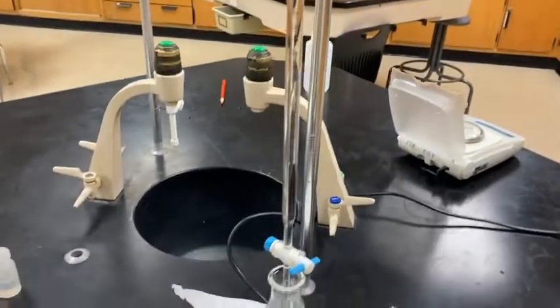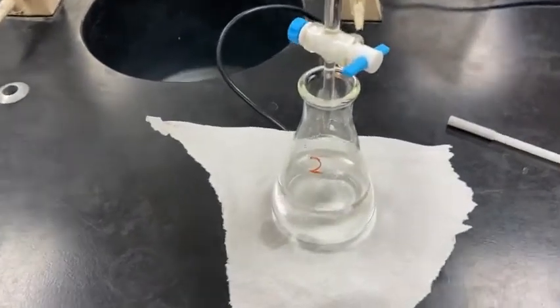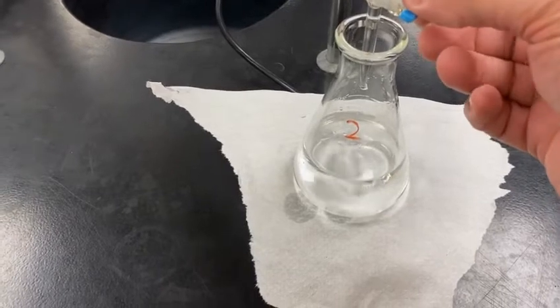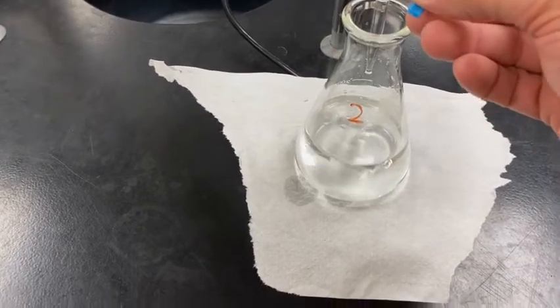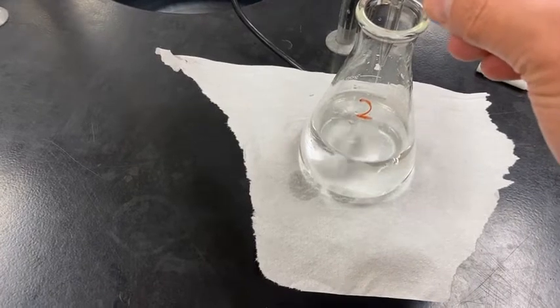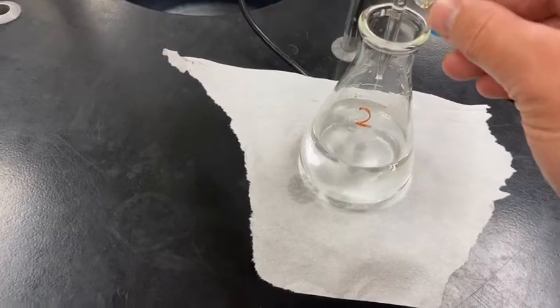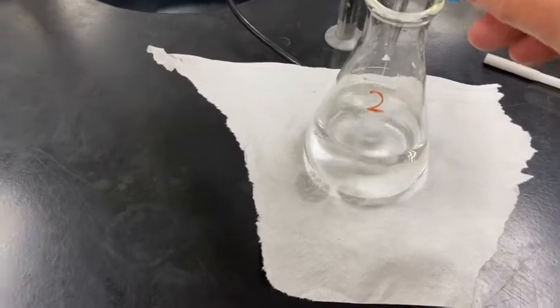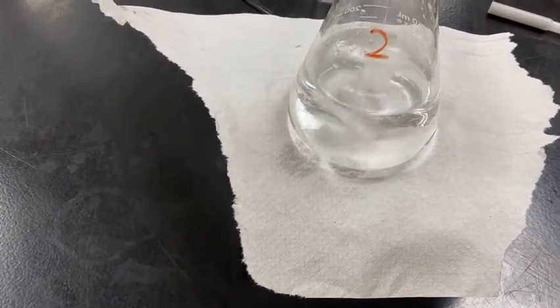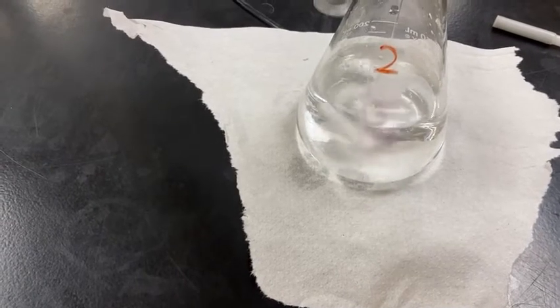Okay, now trial 1, we have an idea of how much volume it took to get it to the end point. And so I know I can blast through the first 30 or so milliliters here of the burette and be pretty safe. So that's exactly what I'm going to do. I'm going to speed this process up. And we should start seeing the pink start to develop in a little bit here.